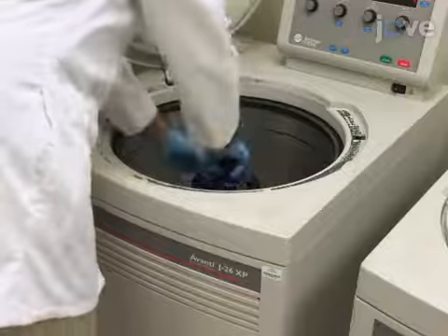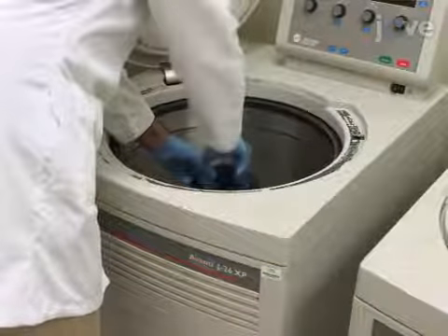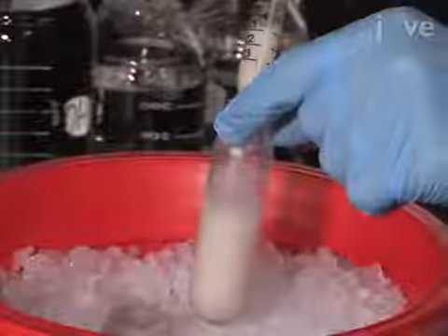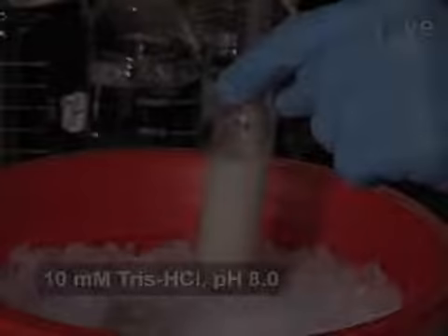After incubation, pellet the cells at 4,500 times gravity for 20 minutes at 4 degrees Celsius. Resuspend the cells in 50 milliliters of ice-cold low-salt buffer by aspirating.